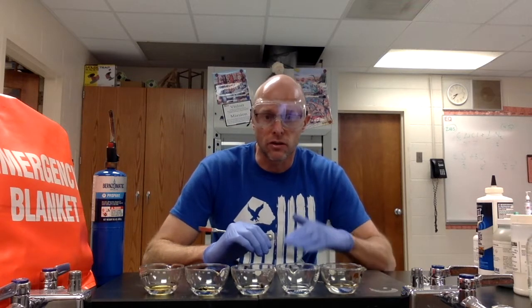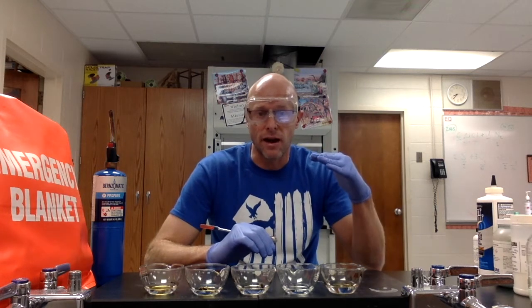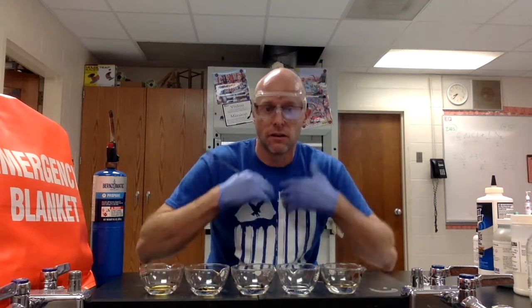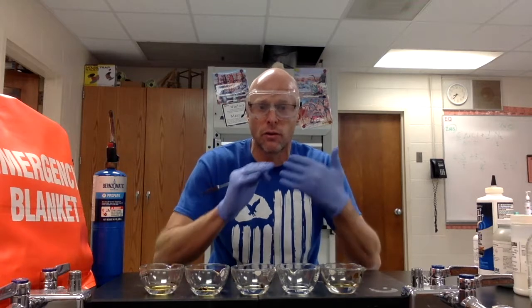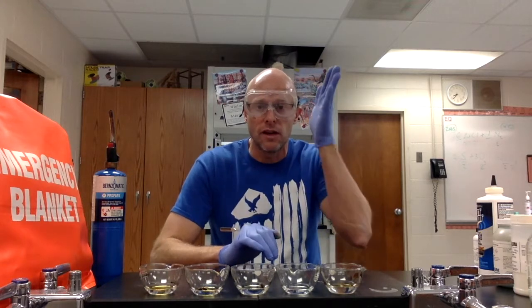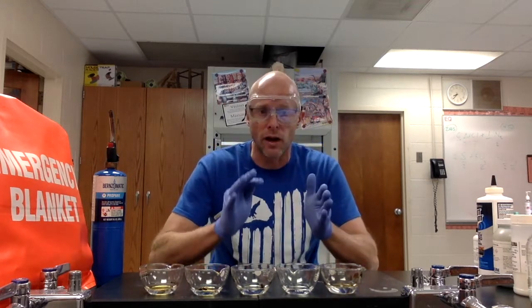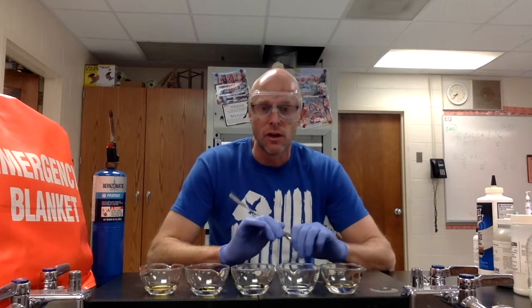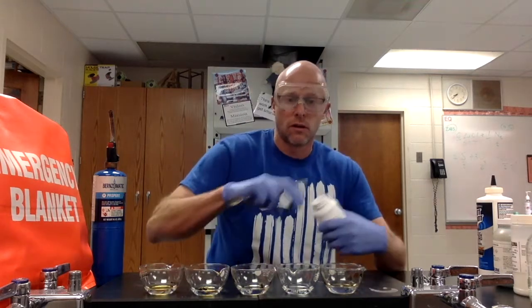Those electrons are jumping to higher energy levels. When they go back down from their excited state to their ground state, they release light. If we looked at this with a spectroscope we'd see different lines of color and could really identify these metals, but we'll see that each of these colors are actually different.